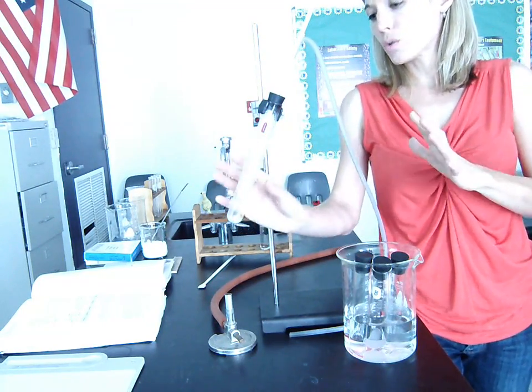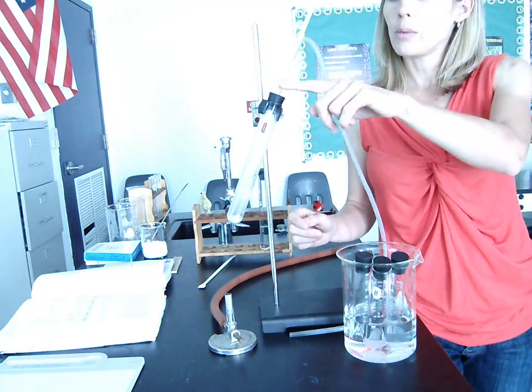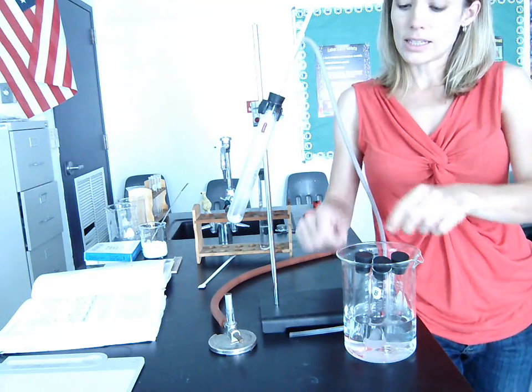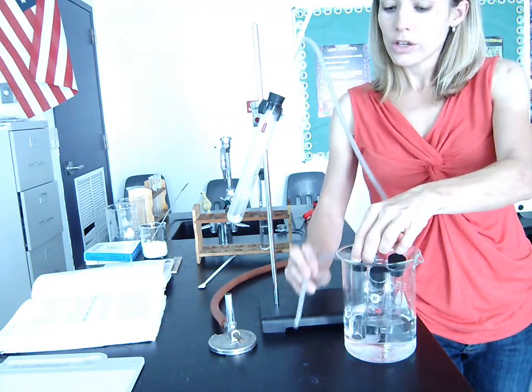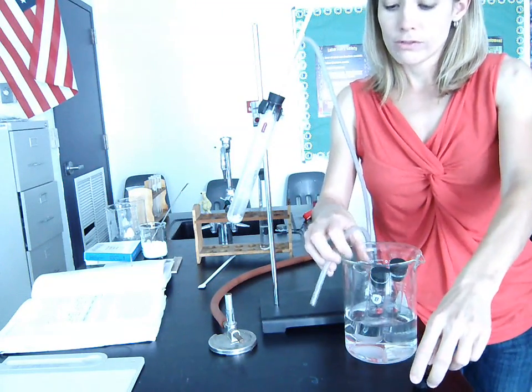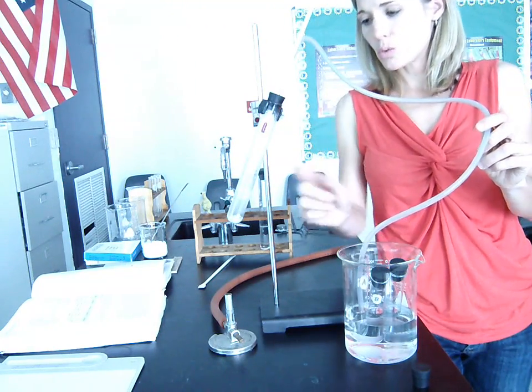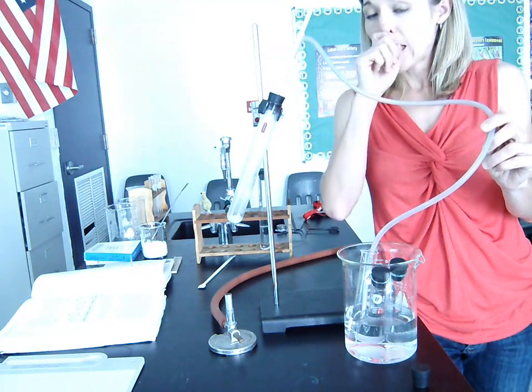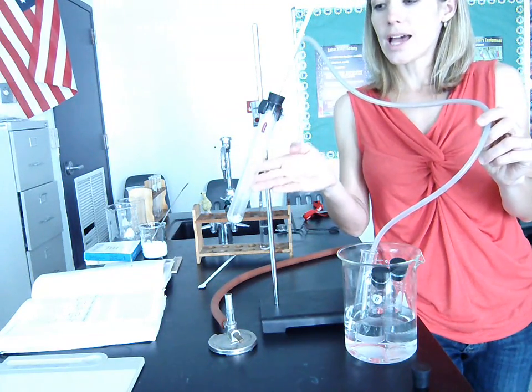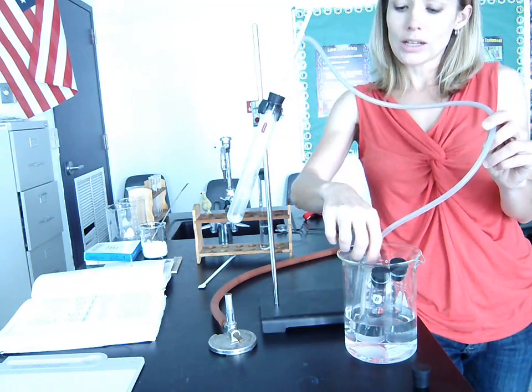So we have our 25 cubic centimeters of our solution, and with a Bunsen burner, we would heat it up and watch the temperature go up. Right about the time that it gets to 80 degrees, we'll notice that our solution starts to boil. From the very beginning, we have our delivery tube over here. When our solution starts to boil at 80 degrees, we know that when you boil a liquid, it turns into a gas. The gas will rise, and it will travel through the delivery tube, and we're going to collect it over here in a test tube.